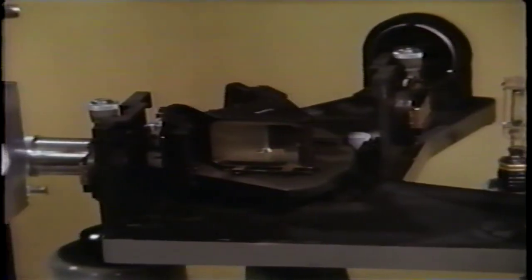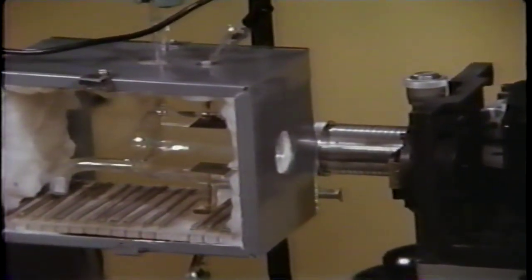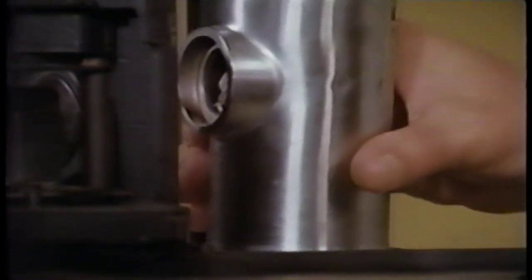When the light enters the cell, it may be absorbed by gas atoms to form ions. All the light that enters the cell must pass through this slit, which admits only a single color at a time. Now, let's cover the lamp, turn it on, and see how the instrument works. The light passes through the prism, which separates it into different colors. Each color of light has a characteristic frequency which determines the energy. The slit admits only one particular frequency at a time to the cell.